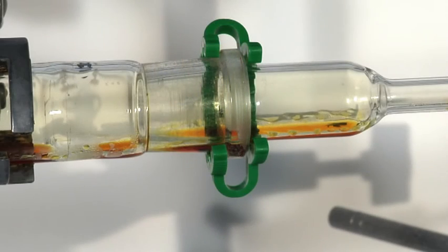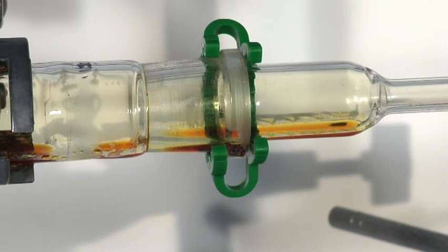The color of the product lightens upon standing, and this indicates that some sulfur dichloride has been formed in the reaction.